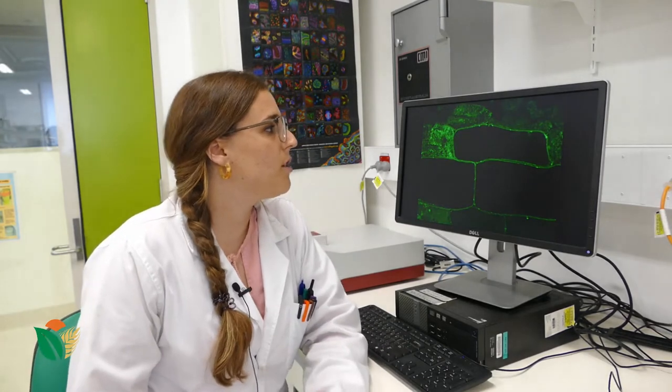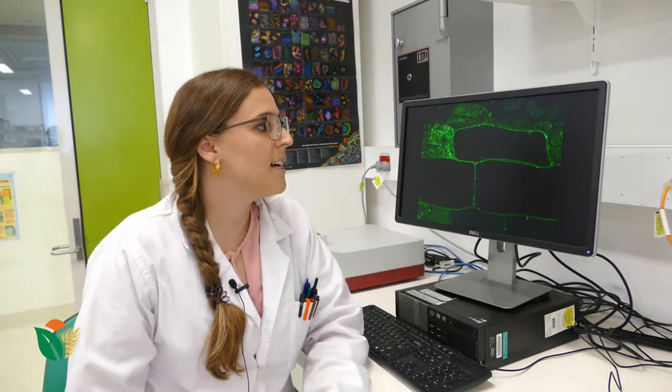We can use a laser attached to the confocal microscope to light up this green protein, which glows in the dark and acts a bit like a torch, guiding us and telling us where the aquaporin is located.